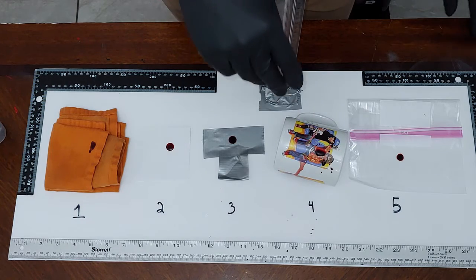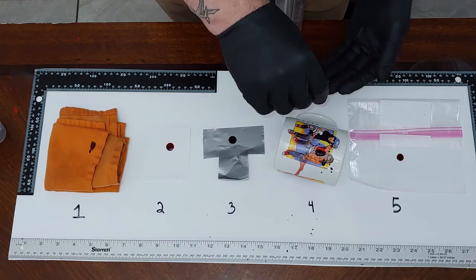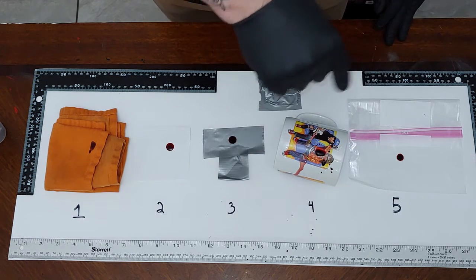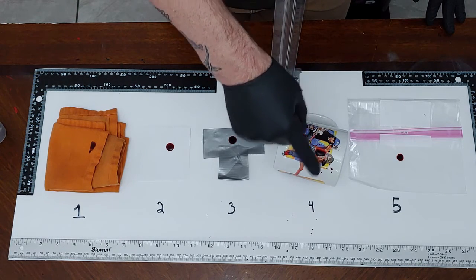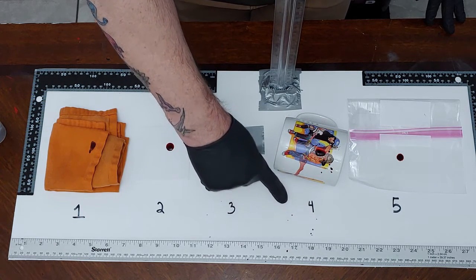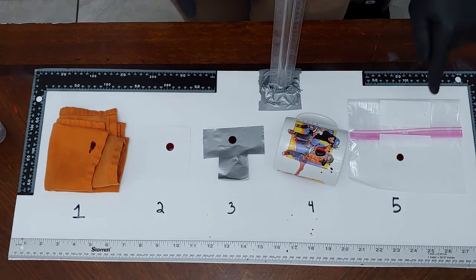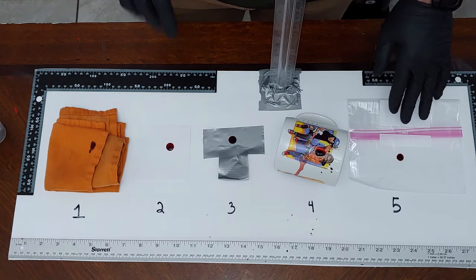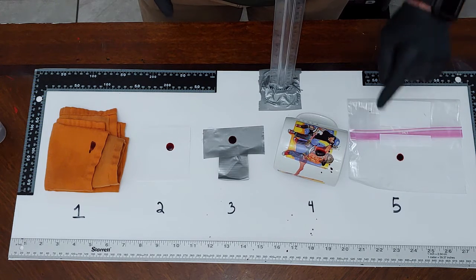On the cup, even though it hit the surface at a 90-degree angle, this surface is curved, so it's not going to allow formation of that perfectly circular blood stain. So it hit the surface, little satellite spatter stains were projected off of the cup onto the surface we were using here. And then there was even some flows that went down the surface. The plastic bag, again, nice, very smooth surface. This is the smoothest surface out of all of these. And you got an almost perfectly circular blood stain.